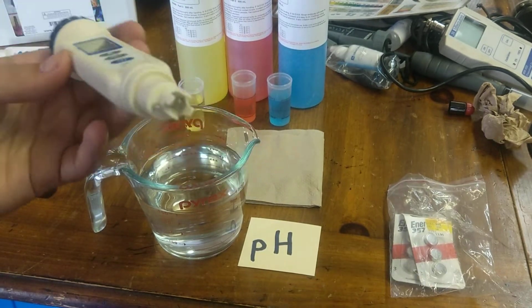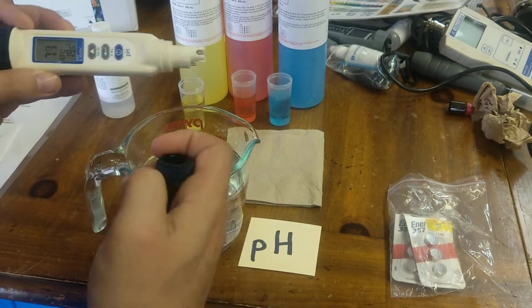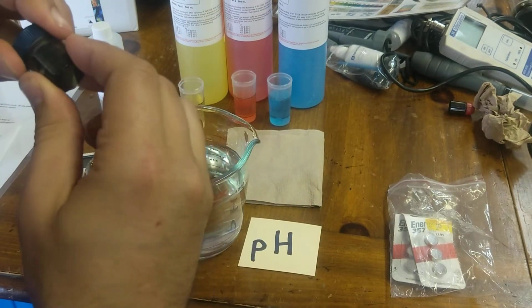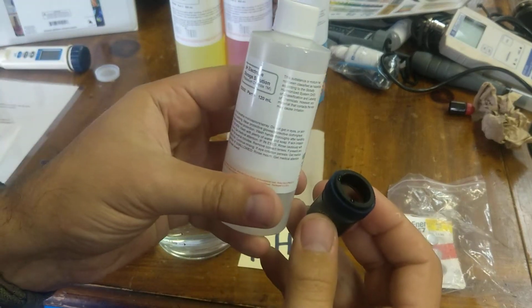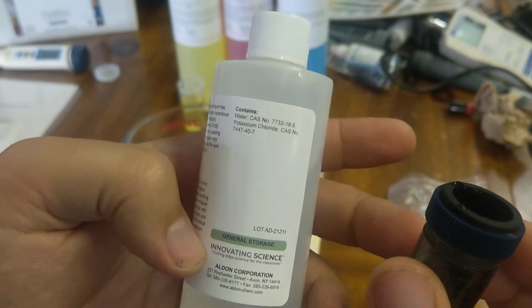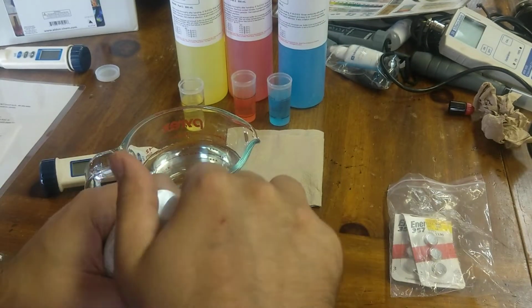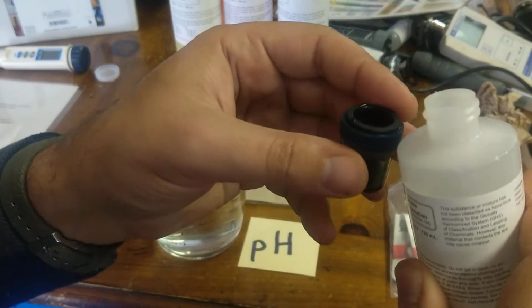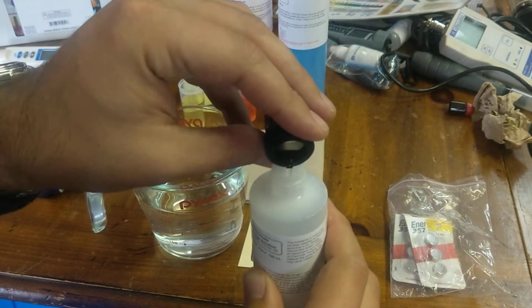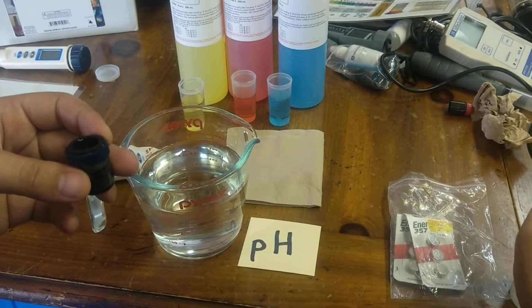If you're going to use these the next day, you can just rinse them off and then cap them directly like so. If you're going to store them for any length of time, again, make sure that the device is off, and you'll also want to put a few drops of this pH electrode solution. It is made up of KCl, potassium chloride, and you just put a couple drops in the cap. Should be a sponge on the bottom, and by putting a couple drops of this on here, you'll make sure that the probes, oops, that's a little bit too much. If you did put a little bit too much, you can just pour it back out there. But you want to make sure that this probe here is moist.